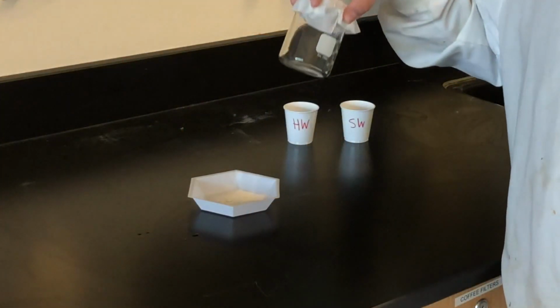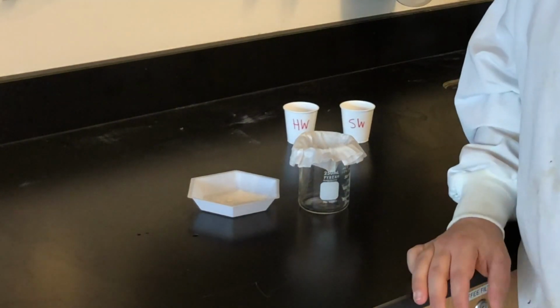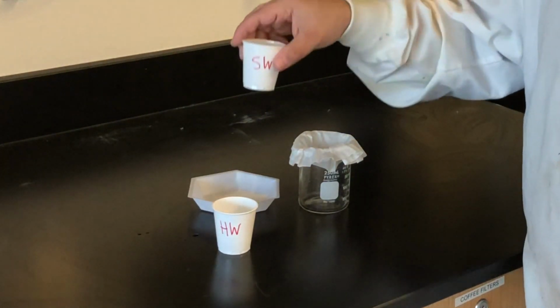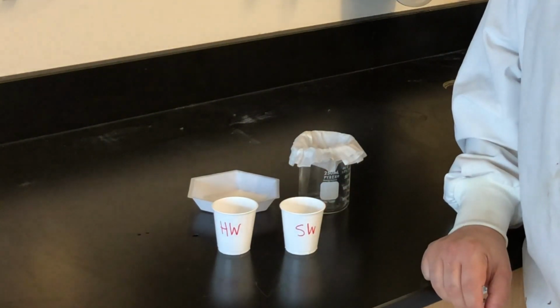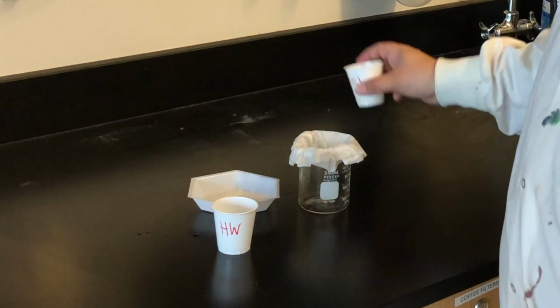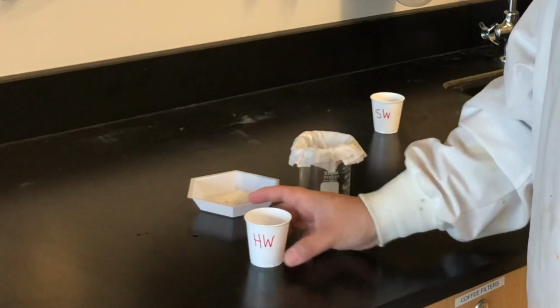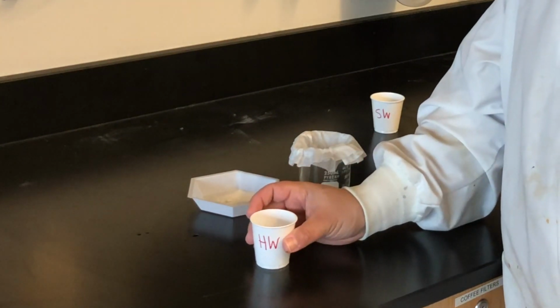I'm gonna start with a beaker that has a coffee filter on top of it that will collect the soap scum for us. And then you have a cup of hard water where I've mixed minerals in with the water, and a cup with soapy water that has pure Ivory soap in it, and we're going to mix them. So you start by combining them in one cup, and what you should notice right away is that the water is going to get a little bit milky colored, okay? Now there will probably be some floating pieces of soap in there, and that's okay.